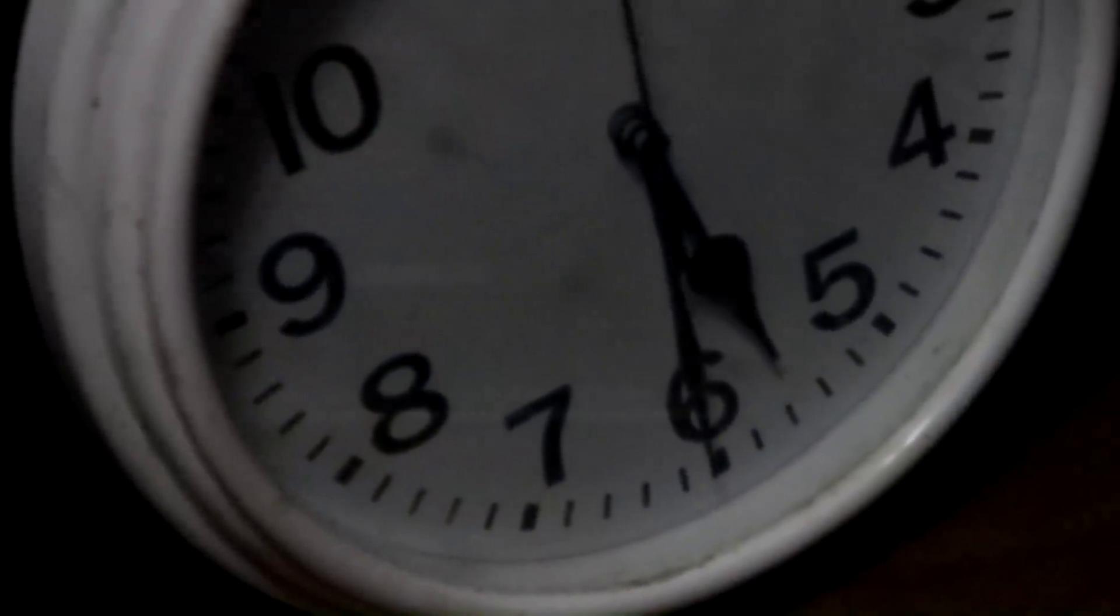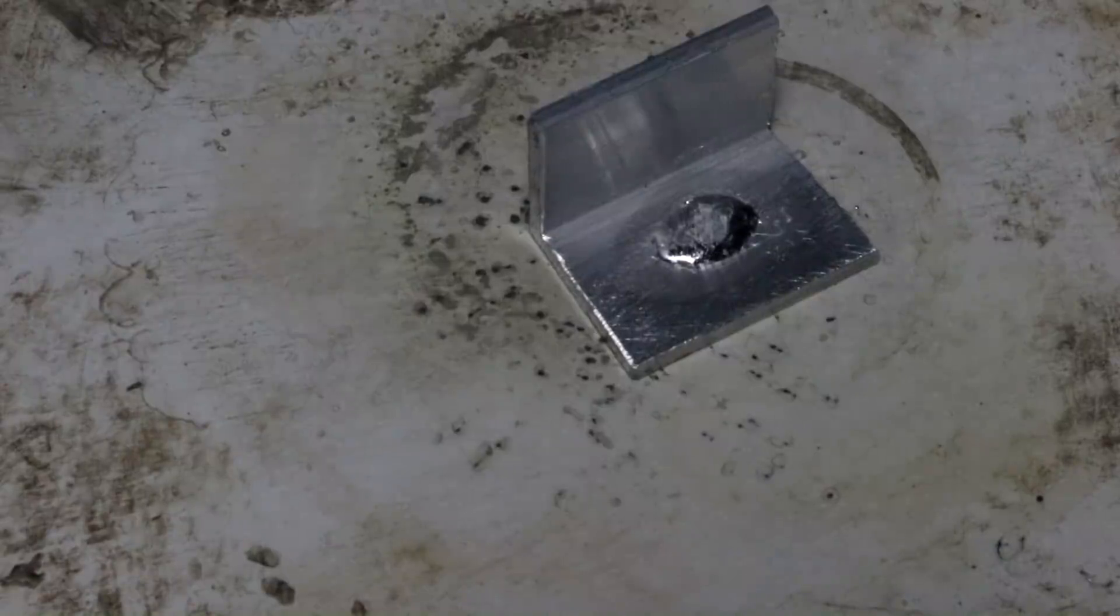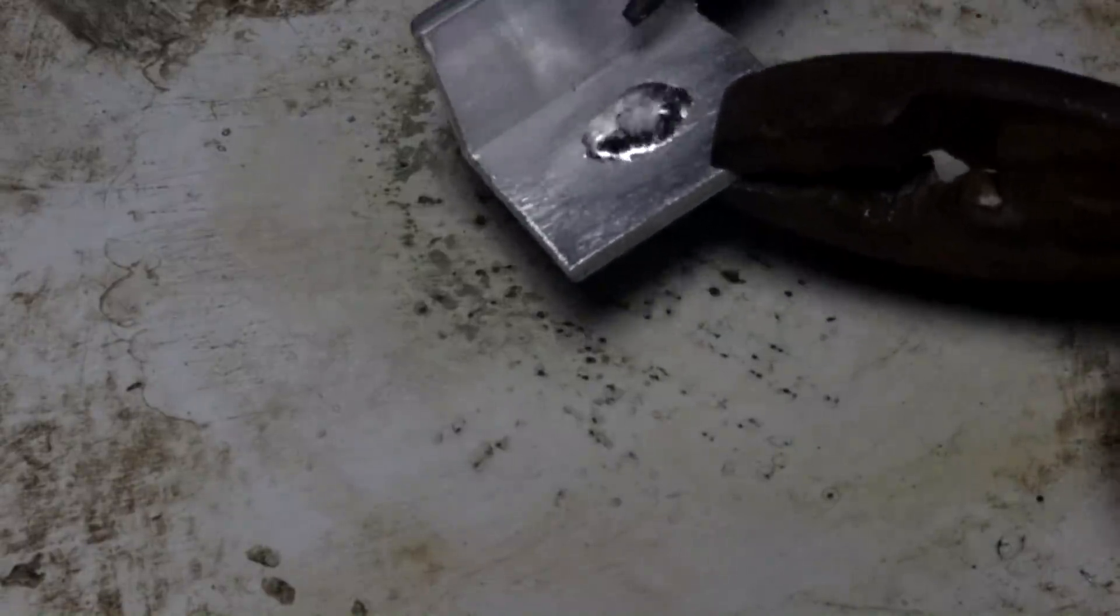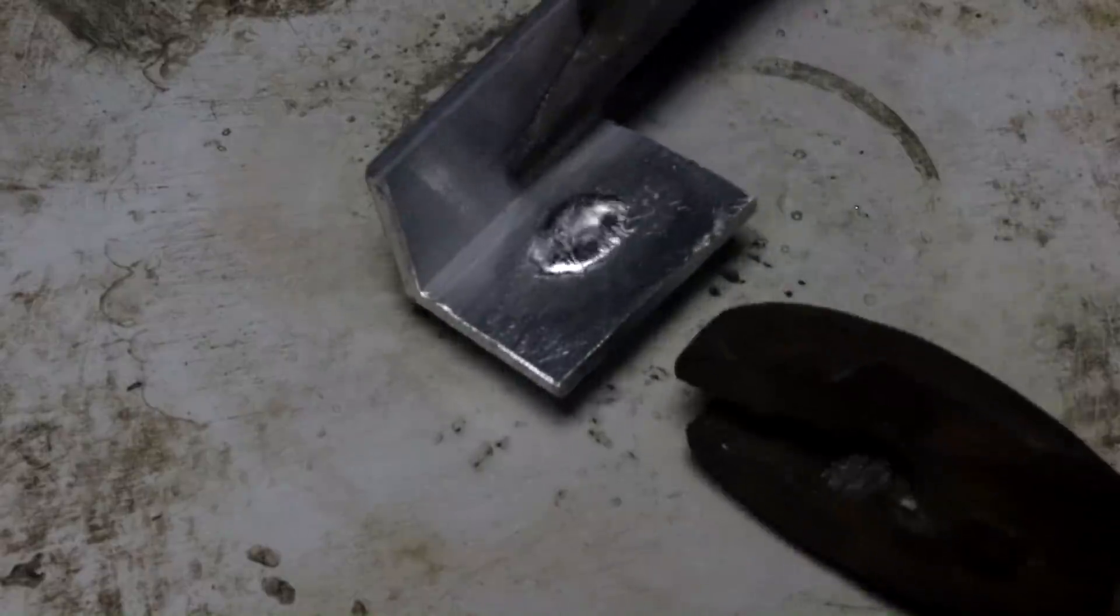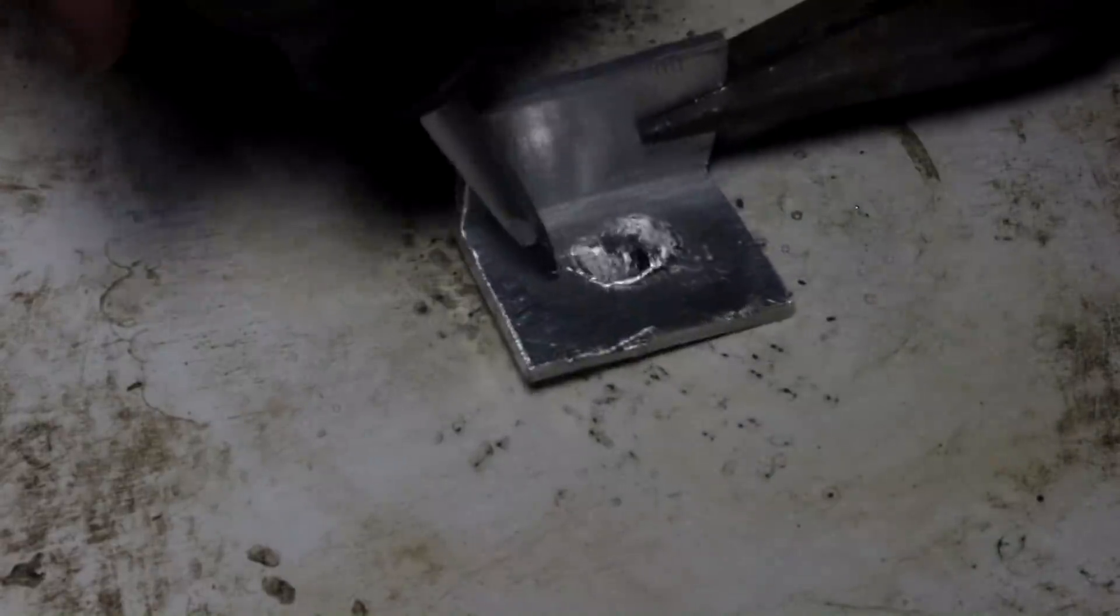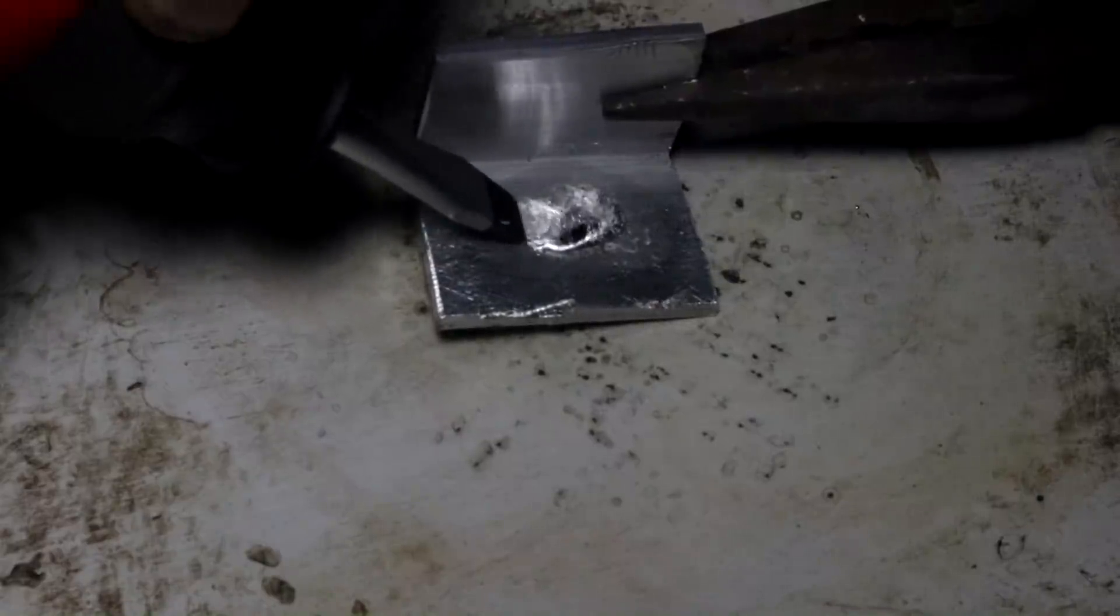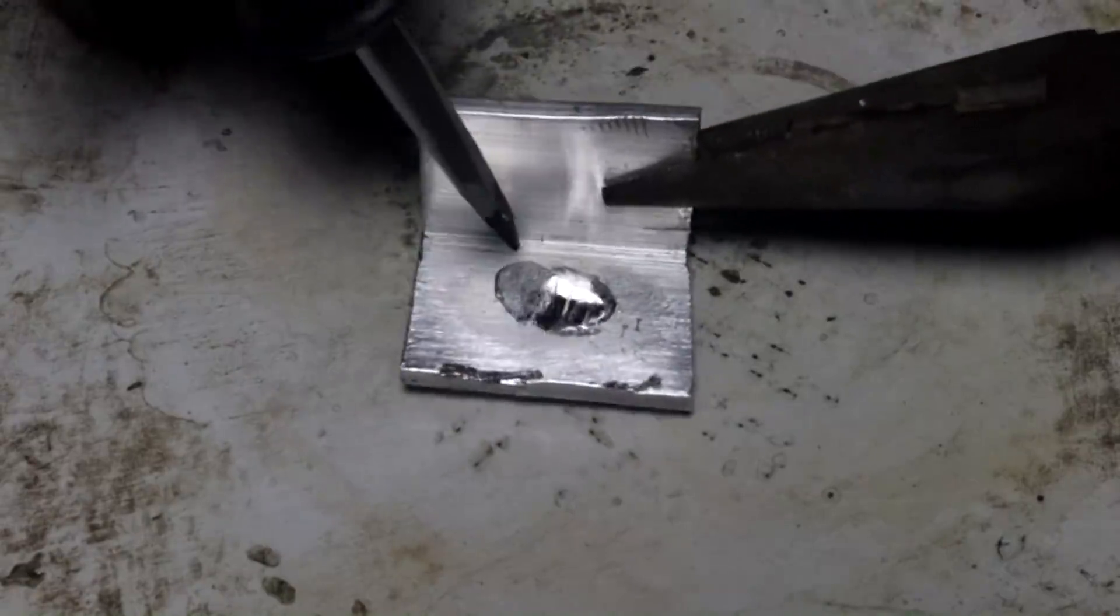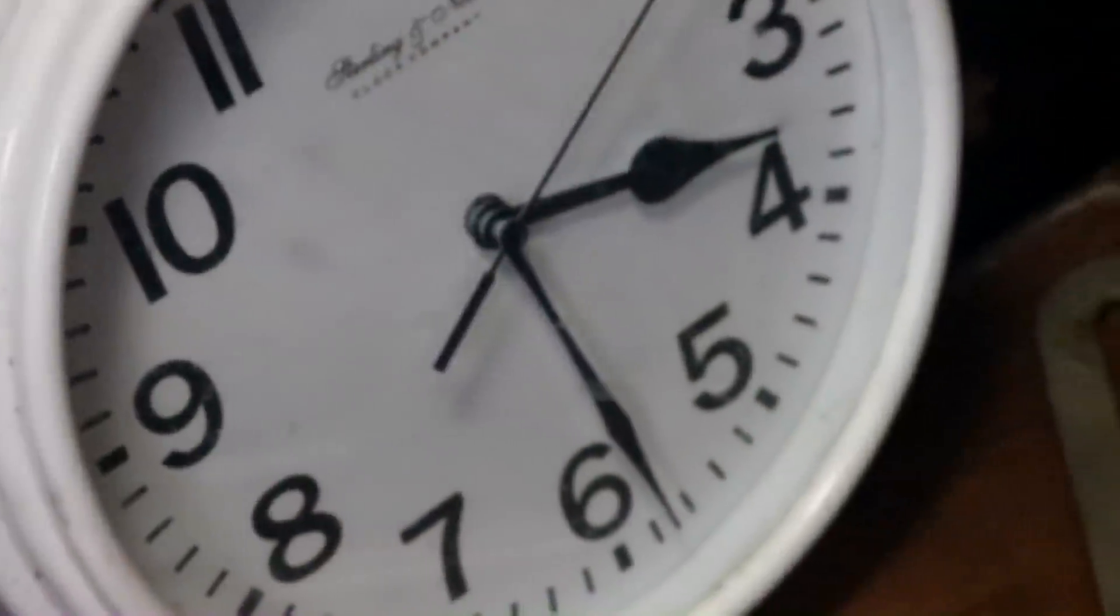Okay. It has definitely altered the piece of aluminum. Let's see what happens if I try bending it. Let's see if it's made it brittle yet. Okay. So the metal appears to be still quite strong. Let's tip it over a little bit. Let's see what it's done to the actual metal. It doesn't appear to have eaten a crater into it or anything.